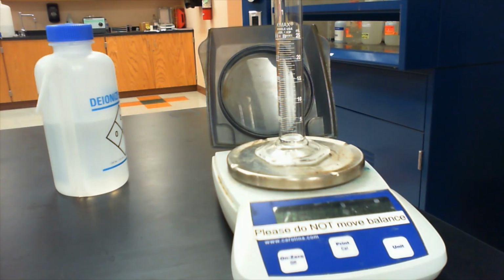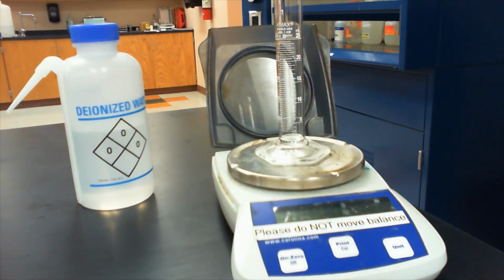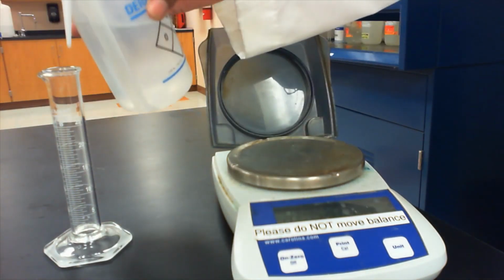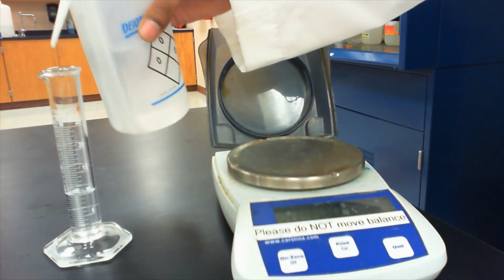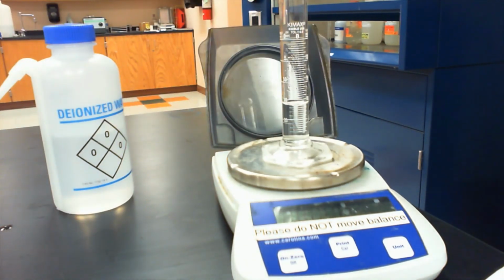We're then going to repeat that process, and we're going to determine the density of three different samples of just regular deionized water. Okay, so we have the mass of our empty graduated cylinder recorded. We're then going to add in 10 milliliters of deionized water to this, and then we're going to get the mass of this sample. Okay, so we can then subtract the mass of the empty cylinder to get the mass of that 10 mils of water. We can then divide the mass by the volume to determine the density. So we'll do that for three different samples of our water.